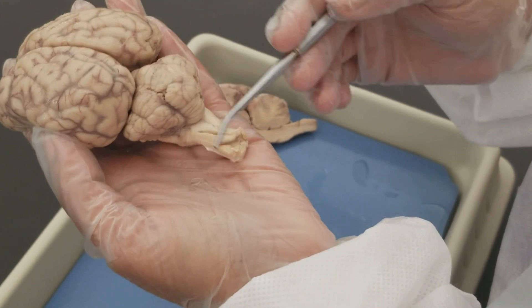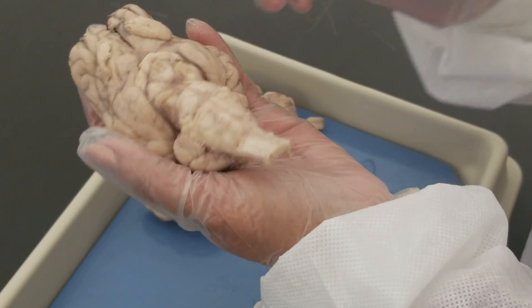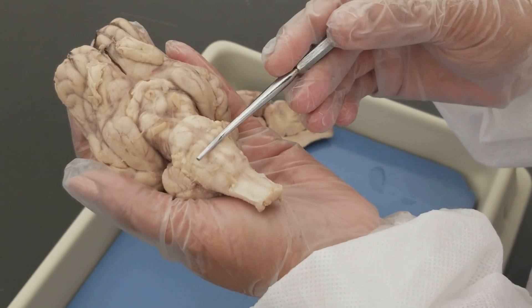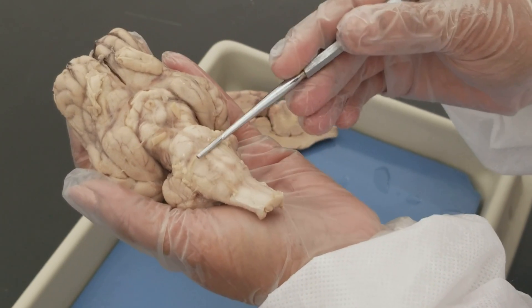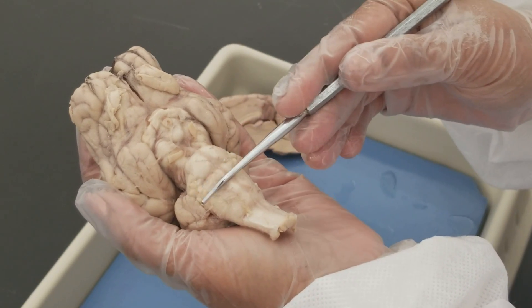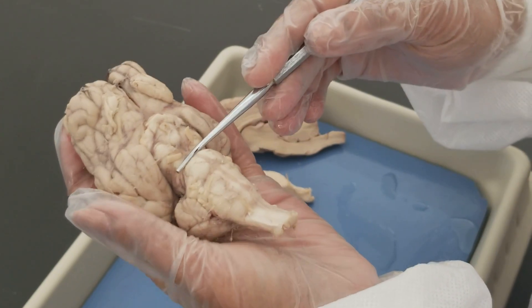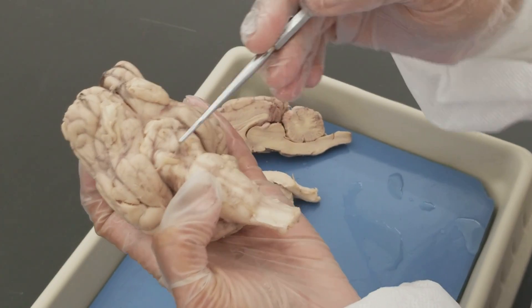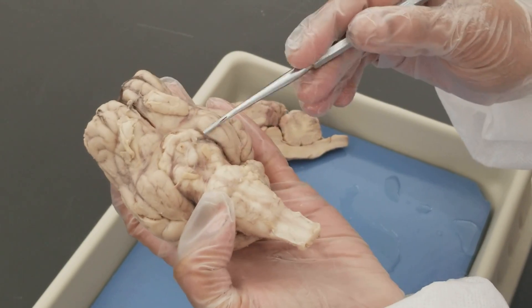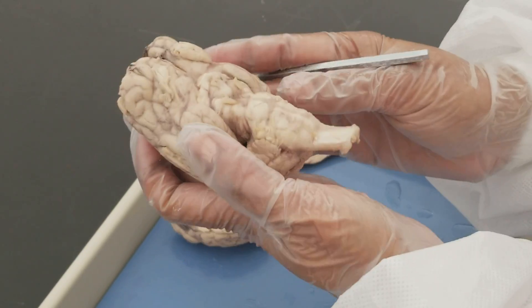Behind the cerebellum is the brainstem, which has three parts. Looking at the inferior view, moving anteriorly from the spinal cord, the first bump is the medulla oblongata — the inferiormost part of the brainstem. The next bump is the pons, the middle part. Then the superiormost part is the mesencephalon, and specifically these are the cerebral peduncles of the mesencephalon — two fiber tracts relaying messages to the cerebrum.